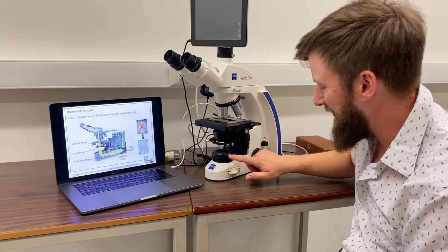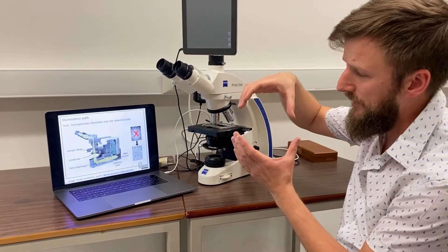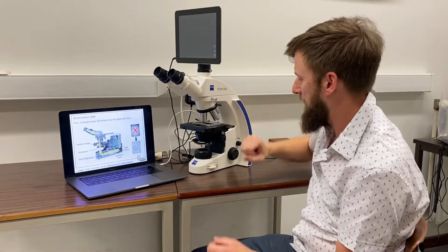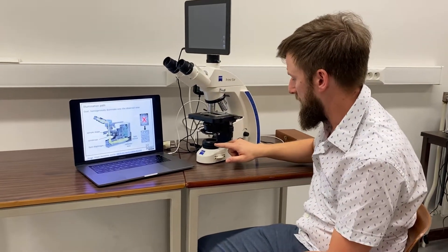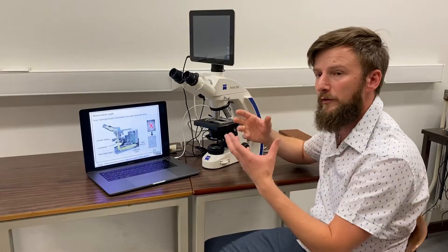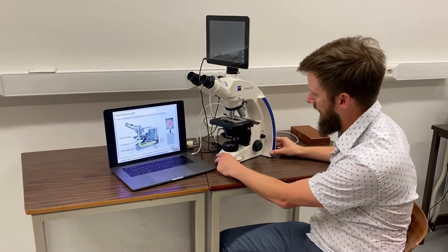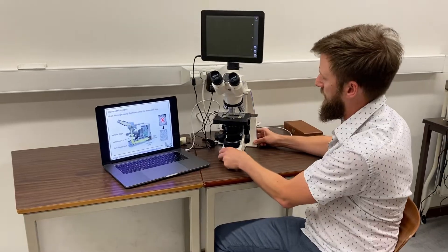Over here is a diaphragm. A diaphragm is basically a ring where you can change the diameter. This is used to determine the portion of the sample that's being illuminated, and this is what I will illustrate now.